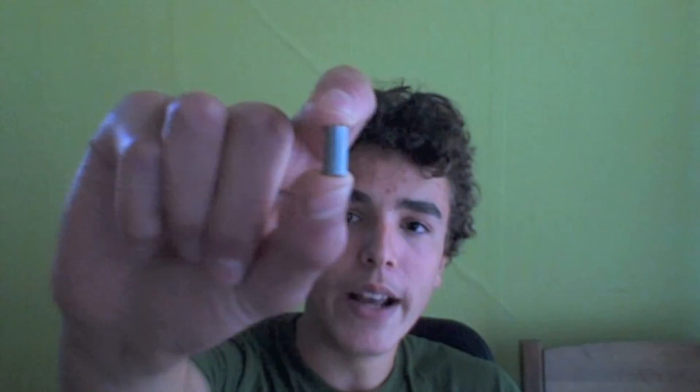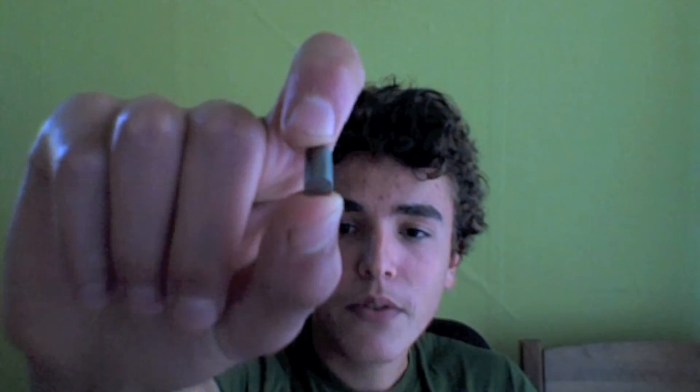The next experiment involves taking the ammonium molybdate starter and just forming a complex with hydrogen peroxide. In neutral solution this is fairly straightforward, and you see a nice slight color change. However, when I add sodium hydroxide and make the solution alkaline, a very cool surprise happens. And I almost forgot — I always try to show you a sample of the pure element in all my videos. So here is a sample of molybdenum, not niobium — molybdenum. The metal itself looks quite boring; it's just a little cylinder, and it looks like most of the other transition metals. But in solution, it can do some very cool things.